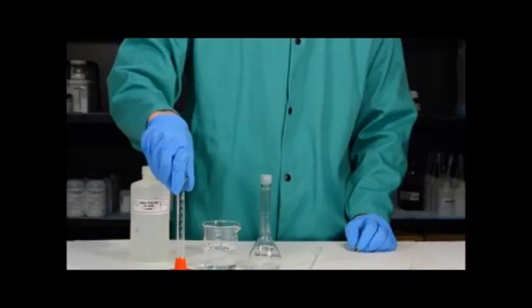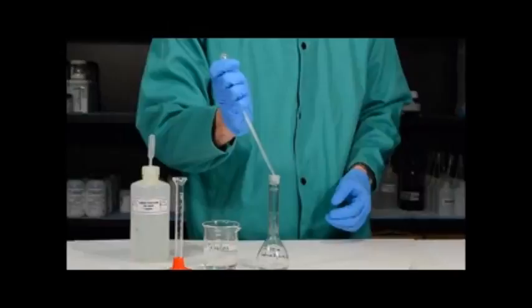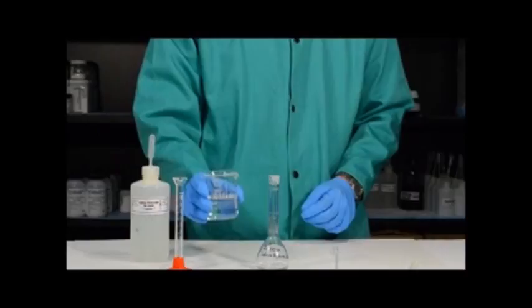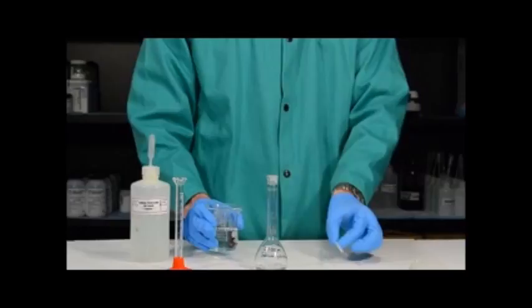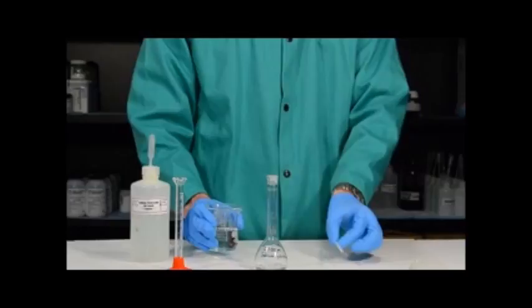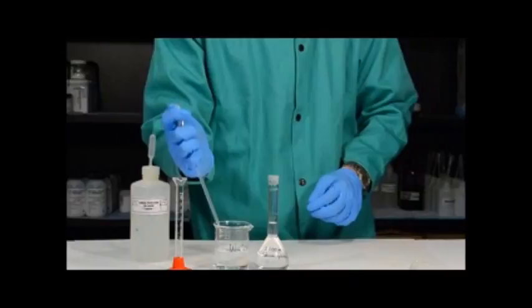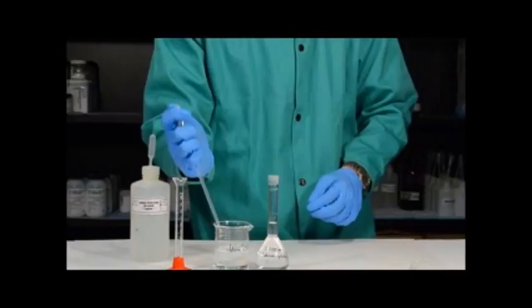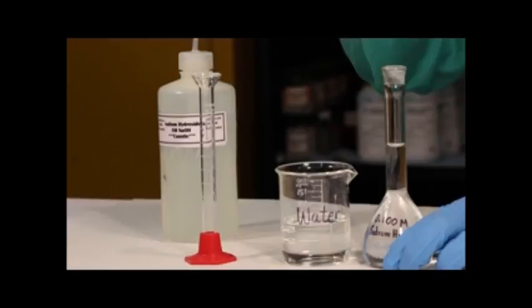Once you've transferred the sodium hydroxide solution and the several rinsings of water into the volumetric flask, you next want to fill the flask with water. Rather than using a pipette — which would take forever — you want to fill the flask by pouring up into the neck. Then once you're in the neck of the flask but still below the calibration line, use a plastic pipette to get the exact amount needed. So I'm going to pour the water up into the neck, then move my head to eye level and fill the flask such that the bottom of the meniscus is exactly at the calibration line.